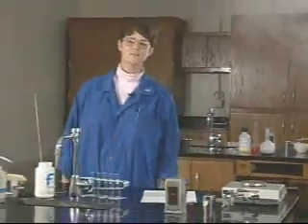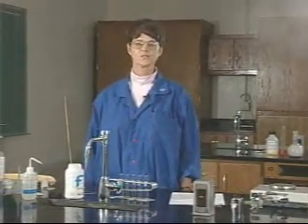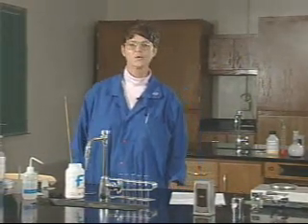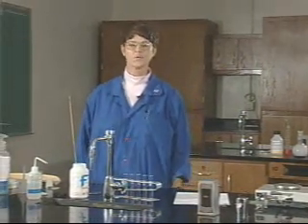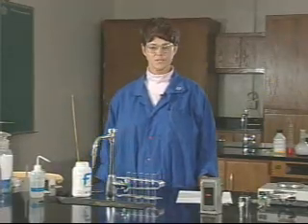Hi, my name is Diane Vance. I'm in the chemistry department at Eastern Kentucky University, and today I'm going to be demonstrating for you the experiment on solubility and rate of solution.